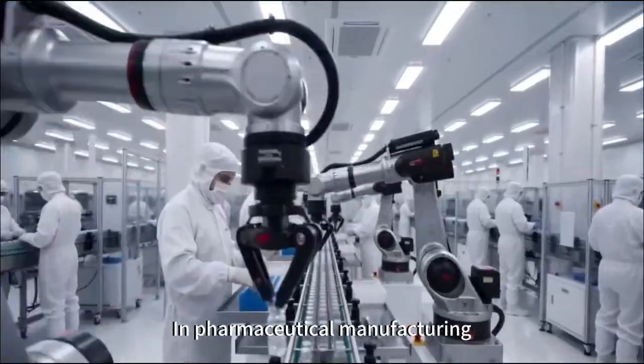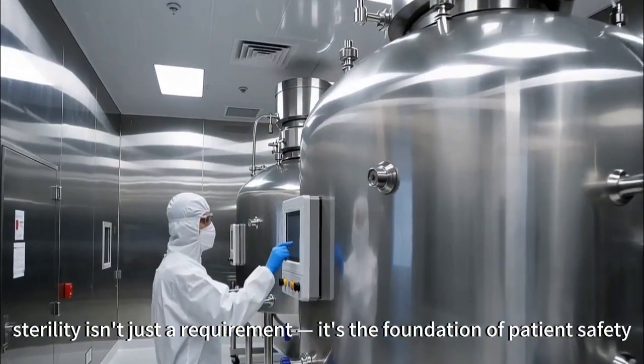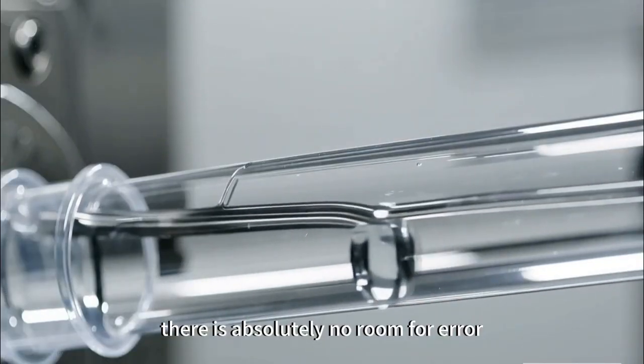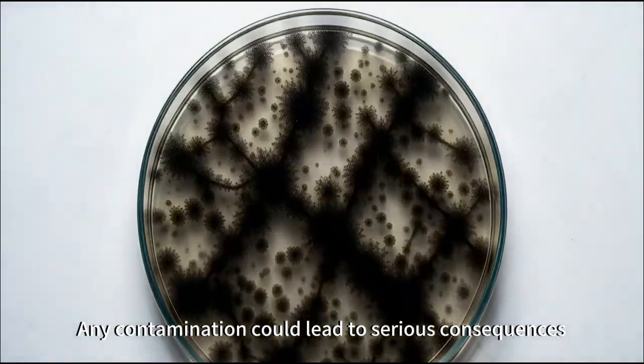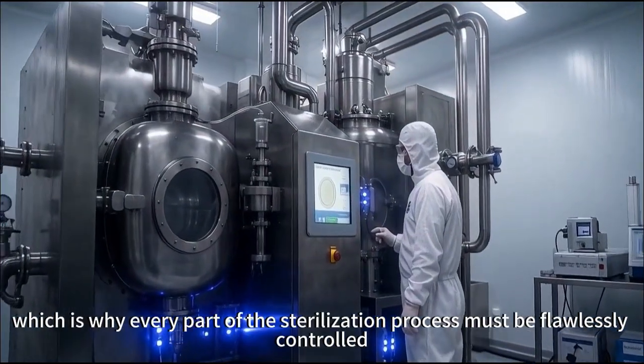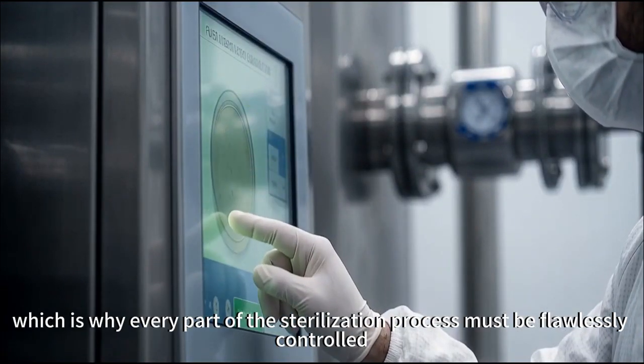In pharmaceutical manufacturing, sterility isn't just a requirement, it's the foundation of patient safety. There's absolutely no room for error. Any contamination could lead to serious consequences, which is why every part of the sterilization process must be flawlessly controlled.